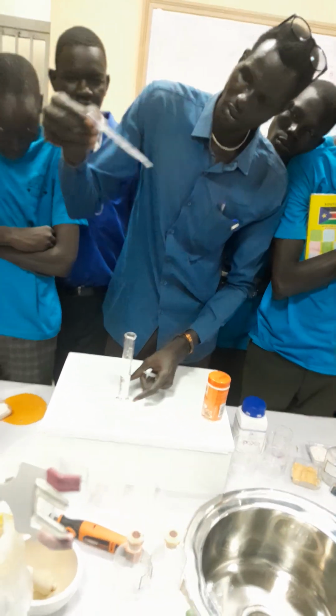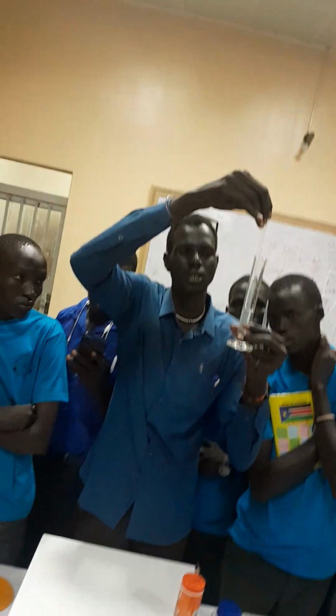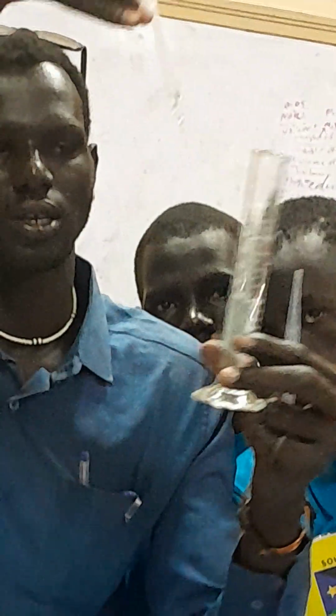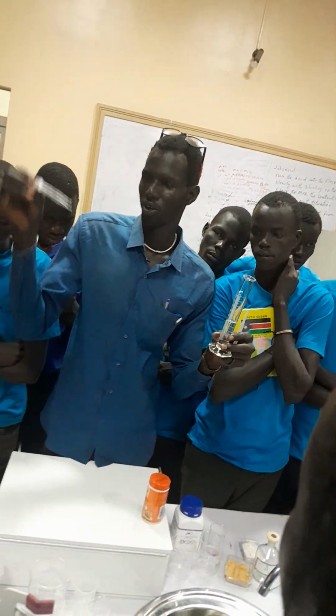You see? Well, now you will see whether it is exactly 25. Hmm. Okay. You take at least another more. Okay. It is now 25. Is it? Yes. Then the function of this one is to either drop out the liquid or you add.